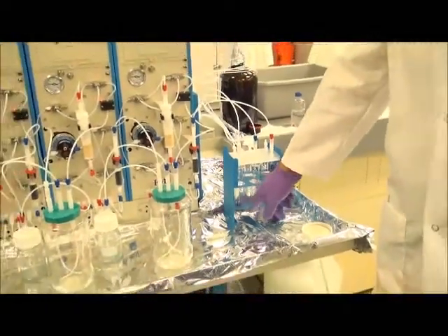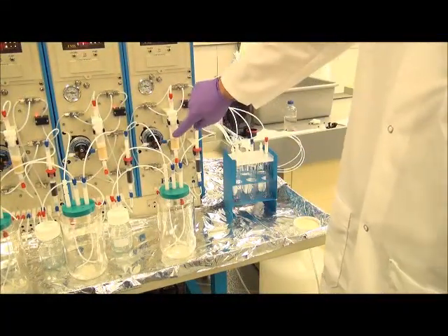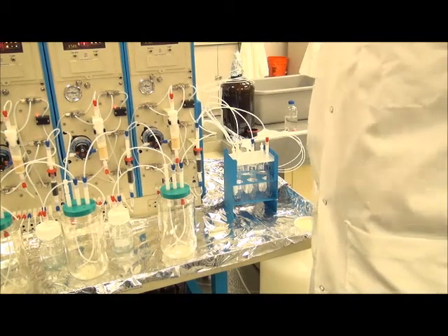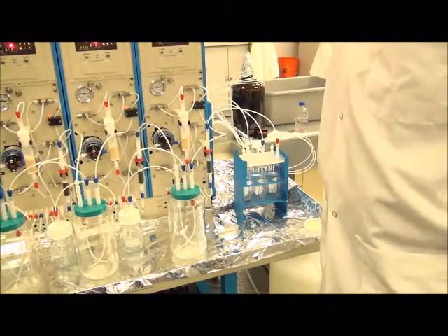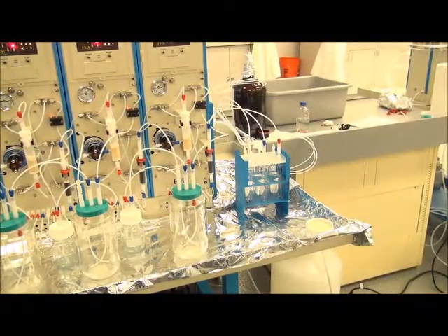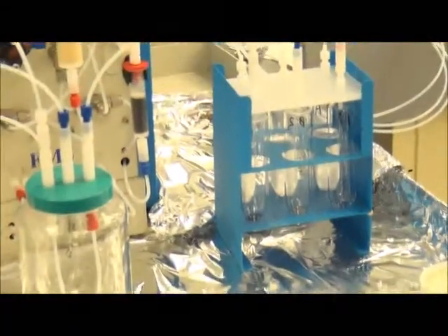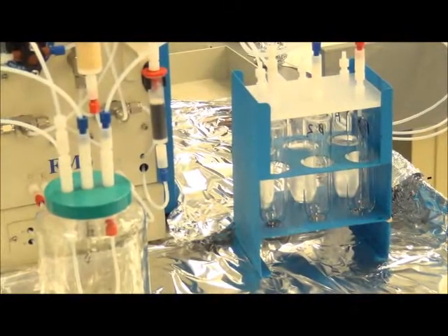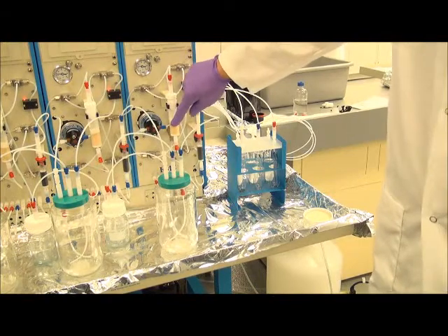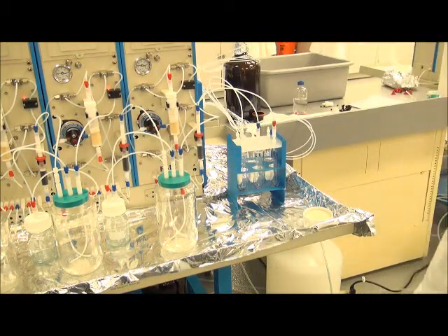I've simply turned the vial so we can see the basic vials as we collect, and we've begun re-exchanging the cartridges and converting the pH to a basic pH 12 before we elute the cartridges for the second fraction. The first step of which is the cartridges will be re-exchanged with methanol to remove any residual methylene chloride, and then an ammonium hydroxide solution will be passed across the cartridges to convert the pH.